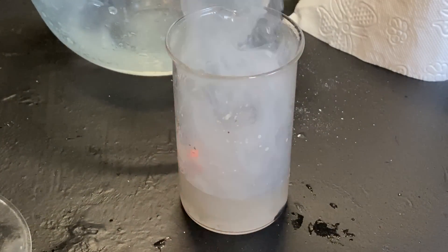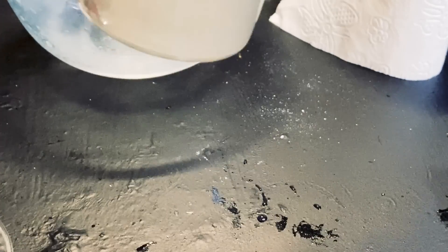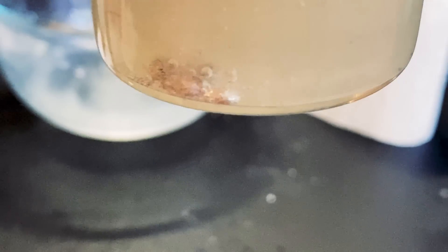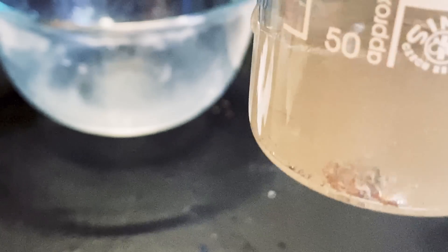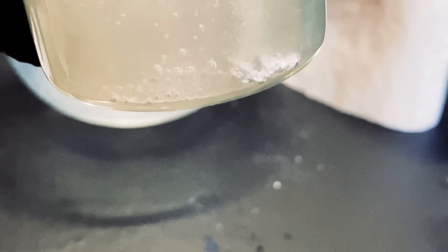At first, a purple explosion occurs, but that's just the regular potassium. Then I look into the beaker, and I see a piece of the potassium amalgam bubbling to produce hydrogen gas, potassium hydroxide, and mercury metal. Potassium amalgam not only moderates the sensitivity of the actual potassium, it also gives it some practical uses, like for example in reductions.